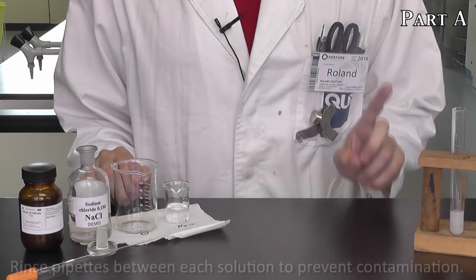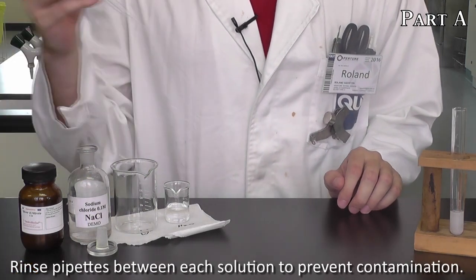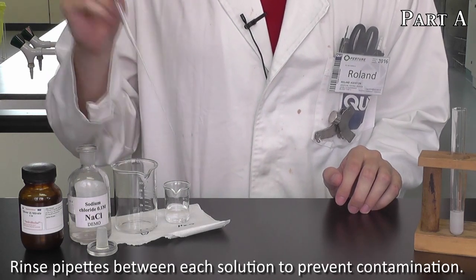Because each group will only have one pipette, it's important that you rinse between each solution so you avoid cross-contamination. You can do that by taking the pipette, drawing up some water, and then dispensing it out into a waste beaker. Repeat this 3 to 5 times.